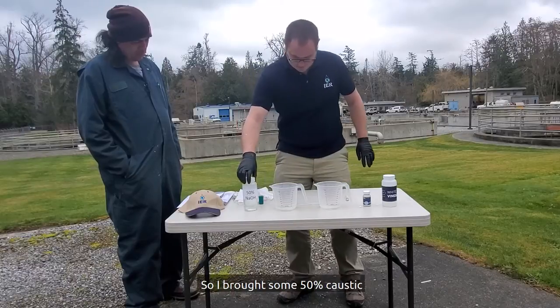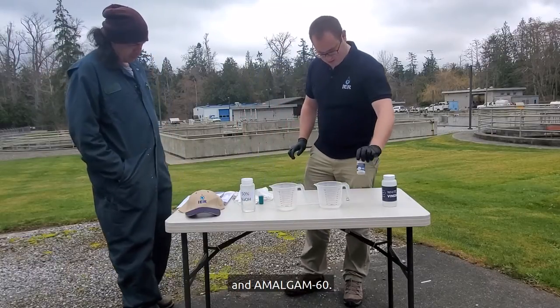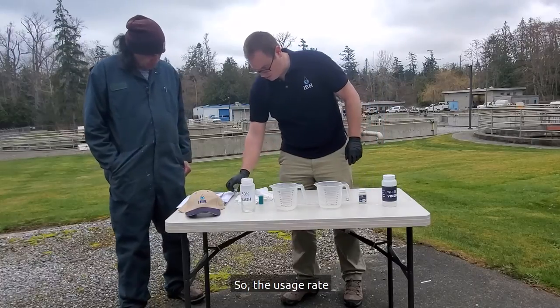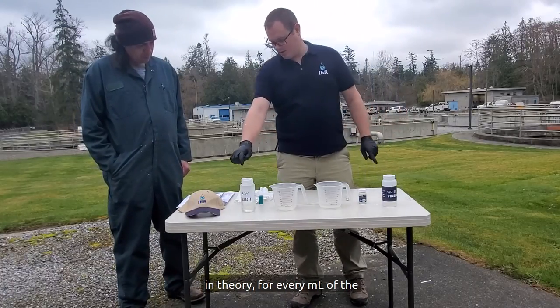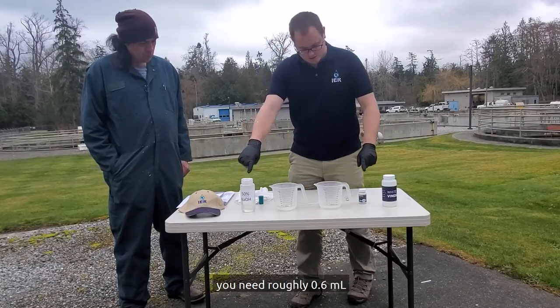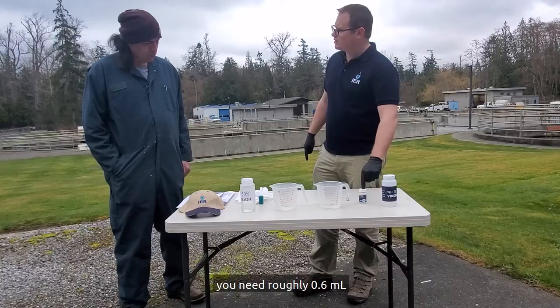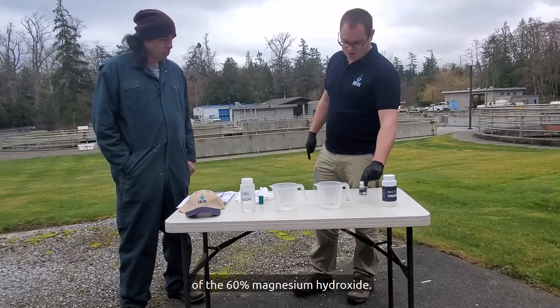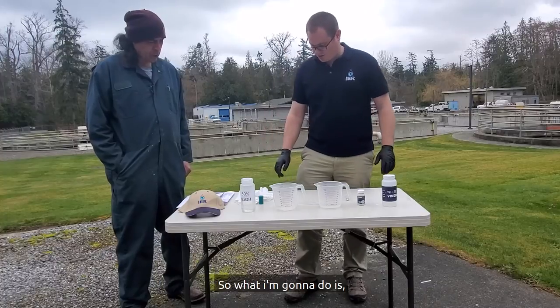I brought some 50% caustic and Amalgam 60. The usage rate in theory is that for every mil of the 50% caustic, you need roughly 0.6 mils of the 60% magnesium hydroxide. That's what we're going to demonstrate here.